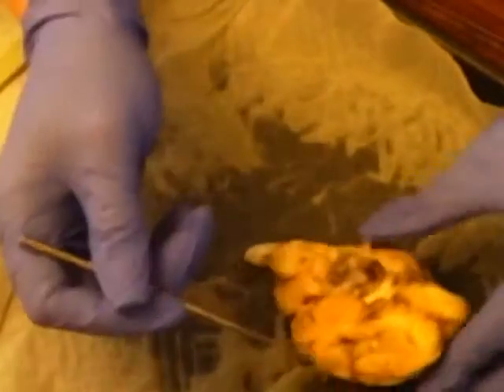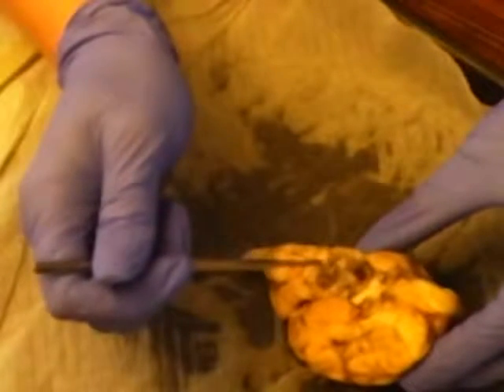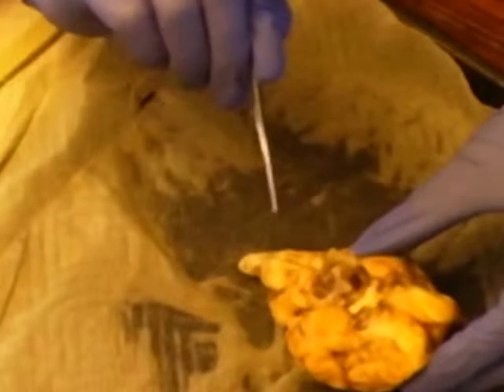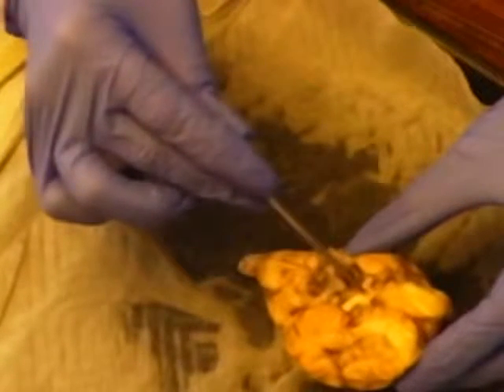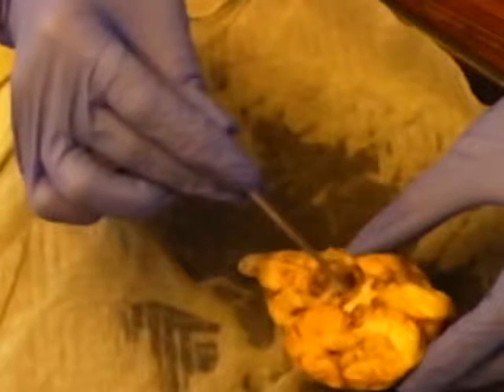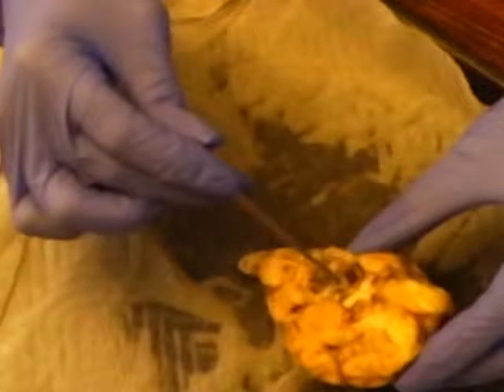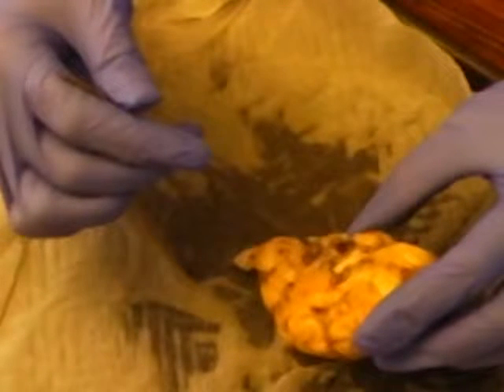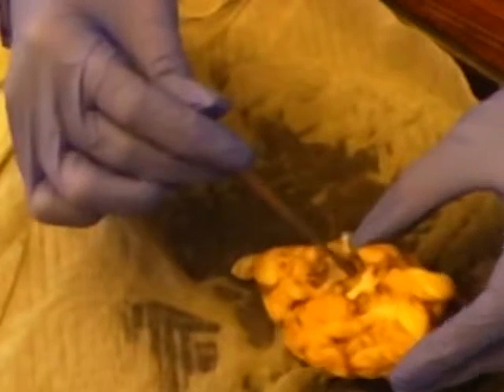Okay, moving on, we are looking at the olfactory bulb, the olfactory tract, which is right through here, the optic nerves, which are up here, see right there, the optic chiasm, which is right here, the cerebral peduncle, which is in the center over here, the hypophysis, which is otherwise known as the pituitary gland, which is right below here. It's this little brown part right there.